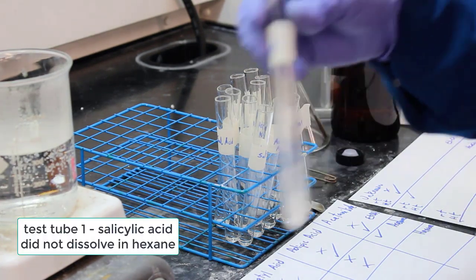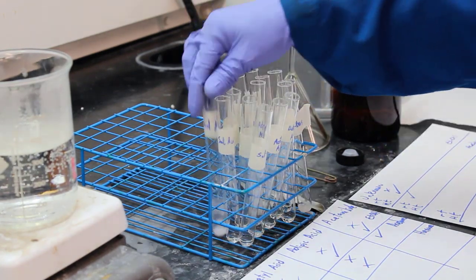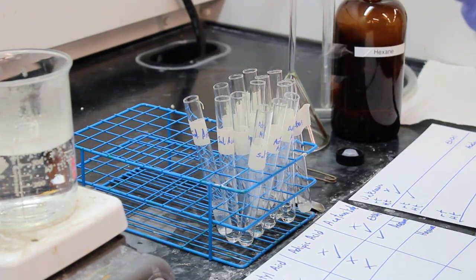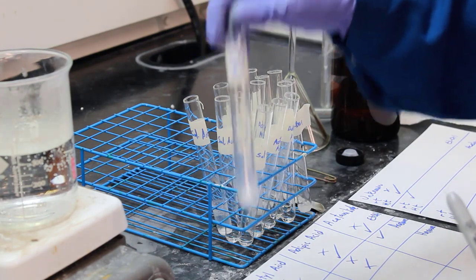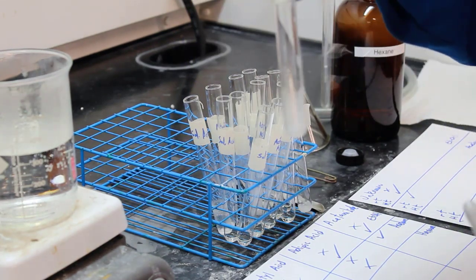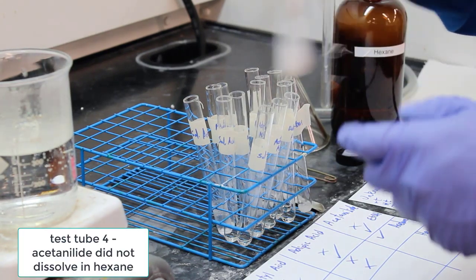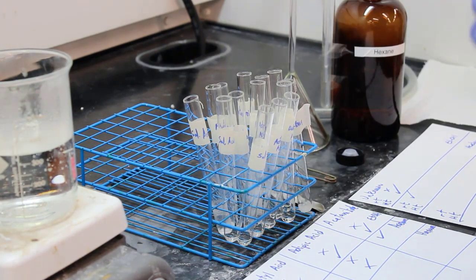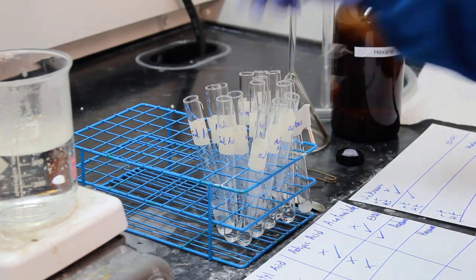All right, salicylic acid is not dissolving in hexane. So that'll have to go into the hot water. Do it now, maybe later. All right, checking the acetylsalicylic acid. It also does not dissolve in hexane at room temperature. Checking the adipic acid. Does not dissolve in hexane at room temperature. Checking the acetanilide. It also does not dissolve at room temperature in hexane. And next up, the unknown is not dissolving in hexane at room temperature.